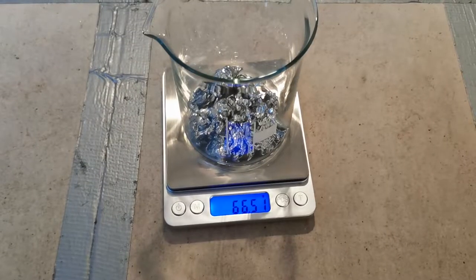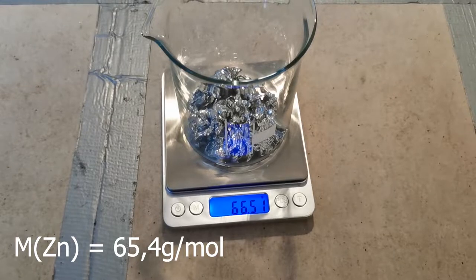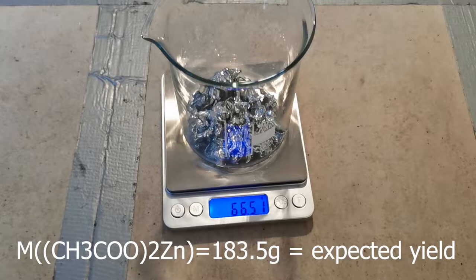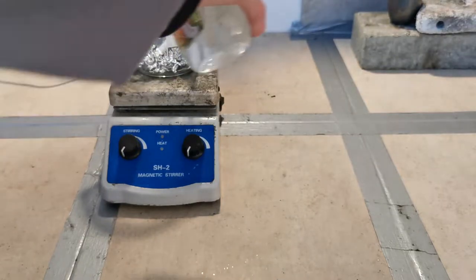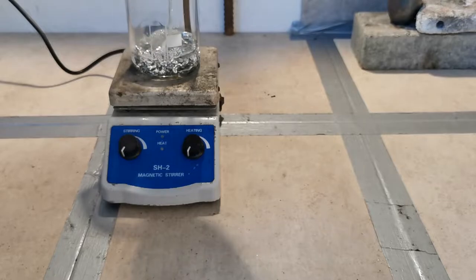It was still somewhat wet though and since the molar mass of zinc is 65.4 grams, I'll round it up and say I have one mole of zinc. So we should also get one mole of zinc acetate. In theory, you could just dissolve this in some acetic acid. I get mine from the grocery store and it's around 25%.